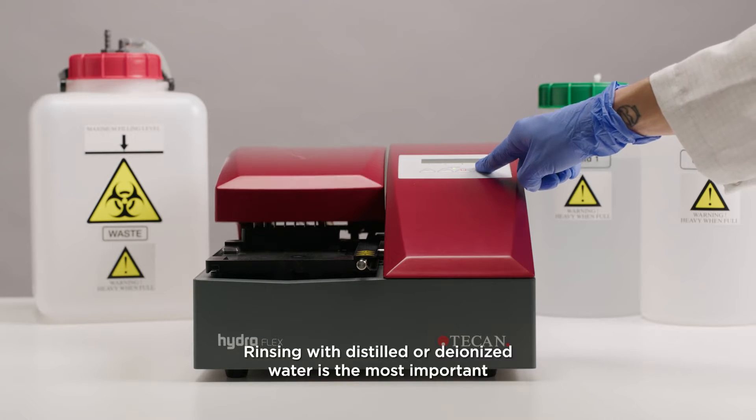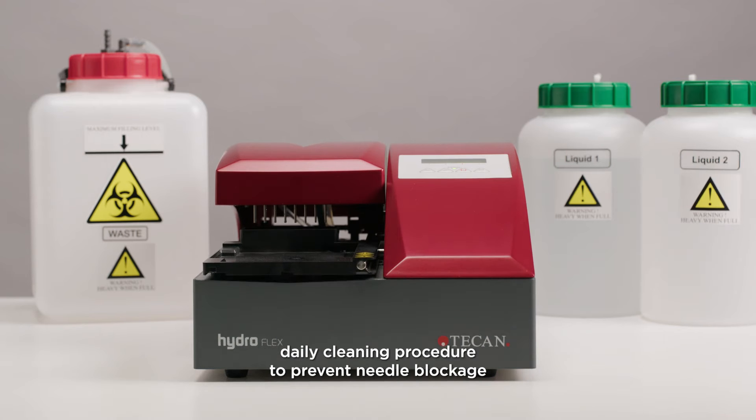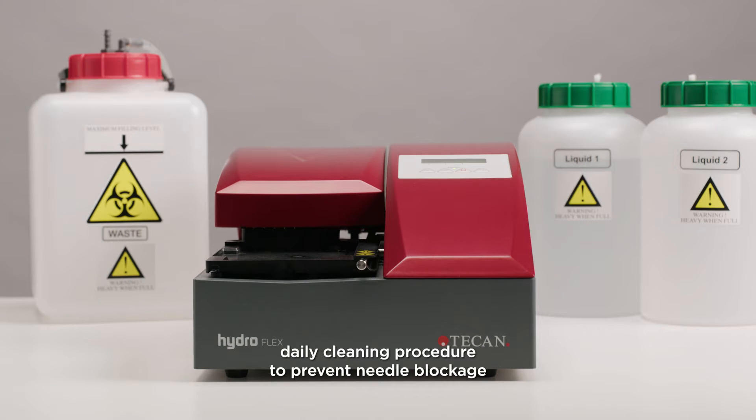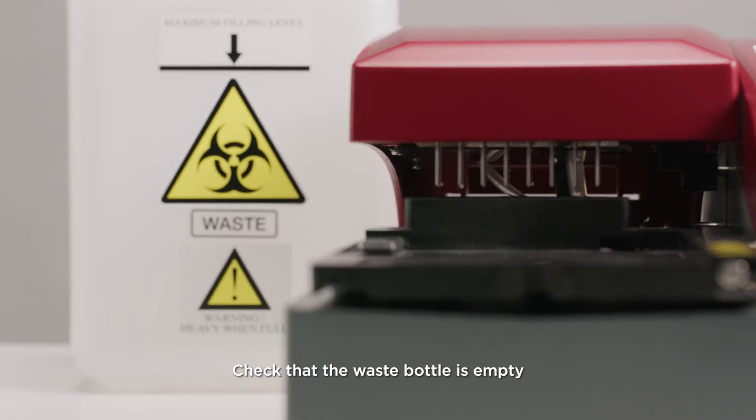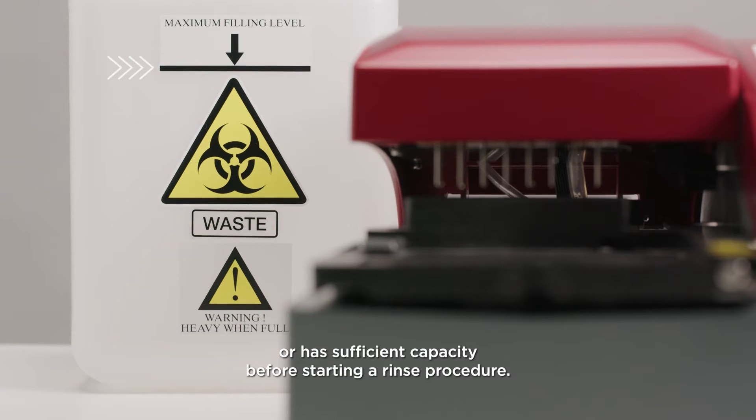Rinsing with distilled or deionized water is the most important daily cleaning procedure to prevent needle blockage and flush the liquid system. Check that the waste bottle is empty or has sufficient capacity before starting a rinse procedure.